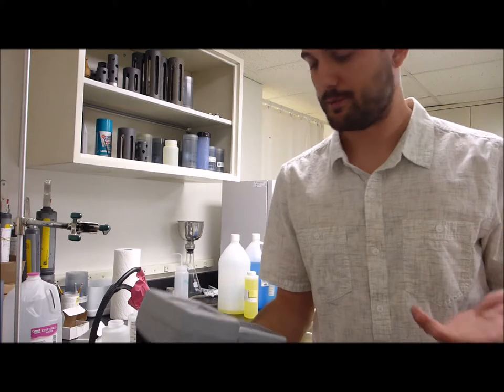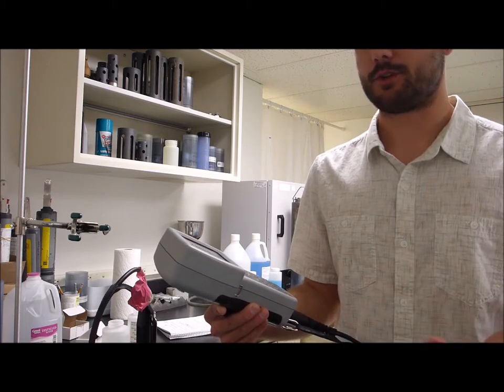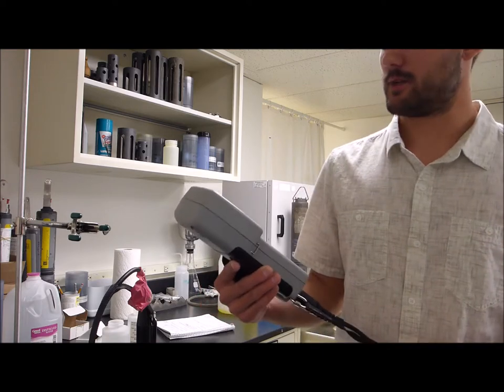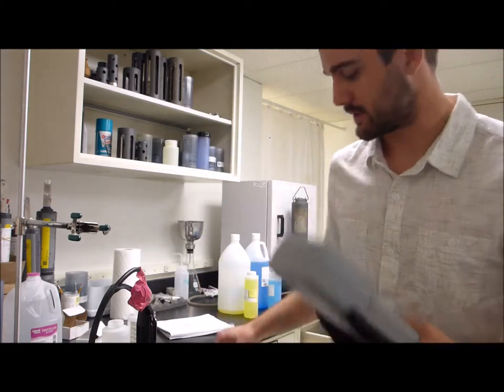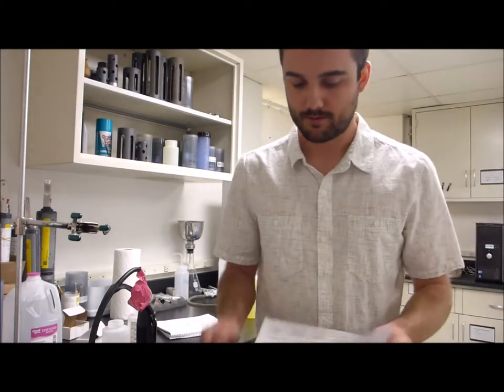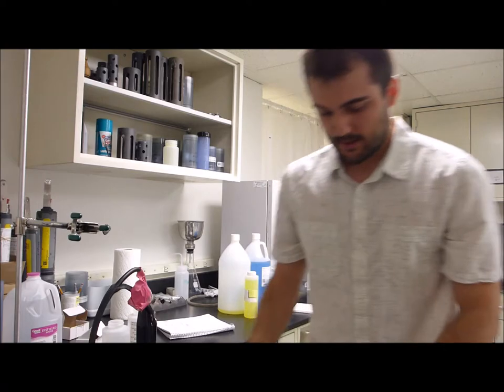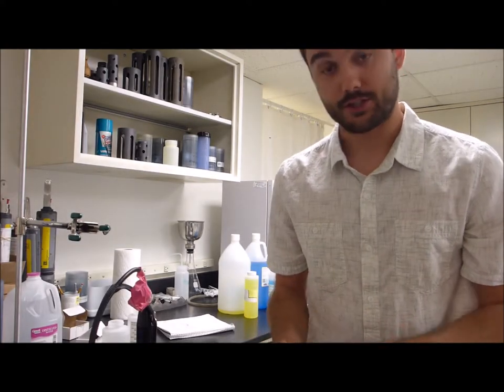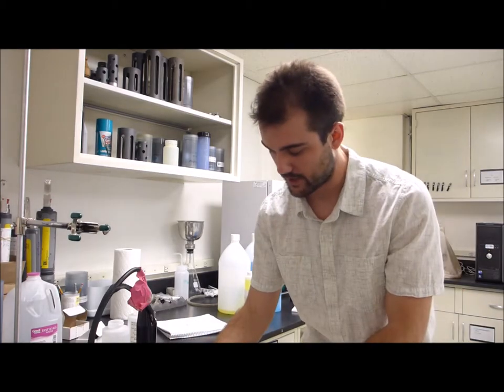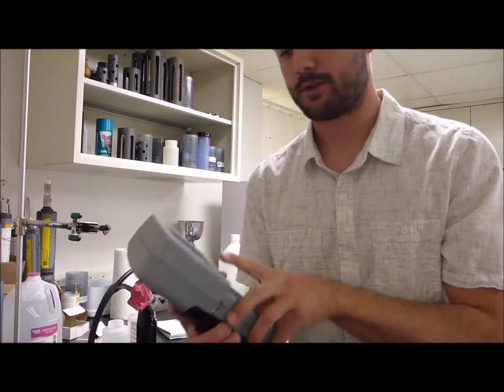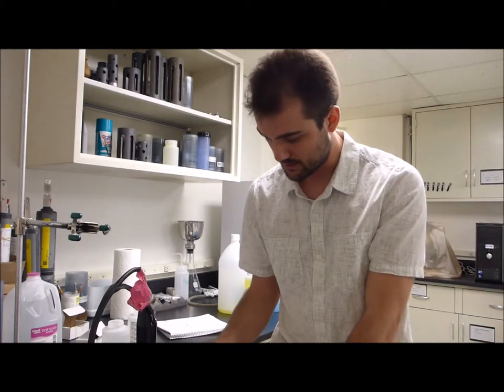The value should be pretty stable if your probes are good, if they're really jumping around or they're really low or really high. Usually really low it'll indicate that there's actually not enough solution so you might have to add some. This is reading right at 986 microsiemens, so that's to be expected. We're going to write that as our pre-value. So we'll write that in here as a pre-value for the conductivity. Then we'll hit the calibrate button on the sonde, and it should lock in right at 1000 microsiemens. So we'll write that as our post-value, or after cal. And before we move on, we're actually going to get the temperature. So we're reading right around 19.3 degrees Celsius. And that's going to come in handy when we do the pH 7 calibration in a second. And we'll hit continue.